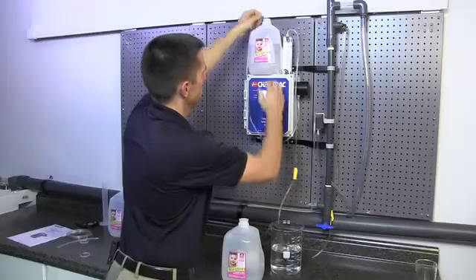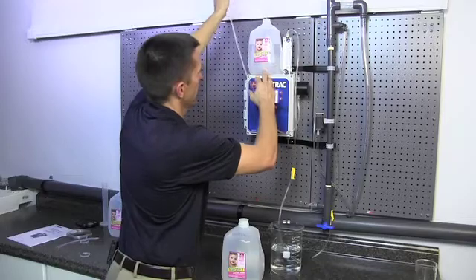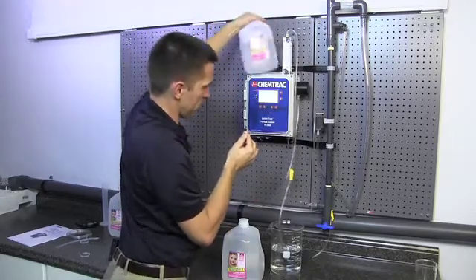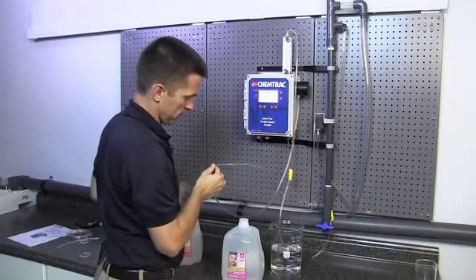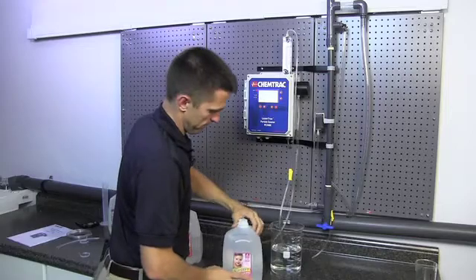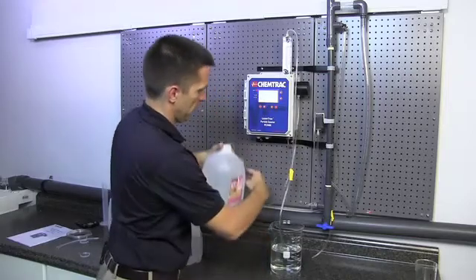Okay, so we'll stop our flow, take the tubing out of this jug and just be careful to not touch this end of the tubing. We'll insert this tubing into the new jug and set that on top.